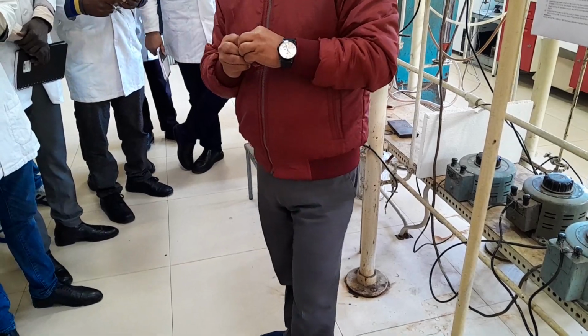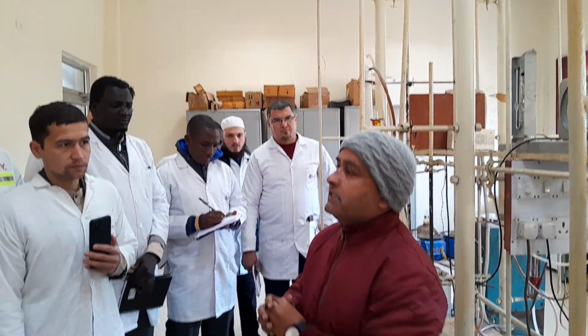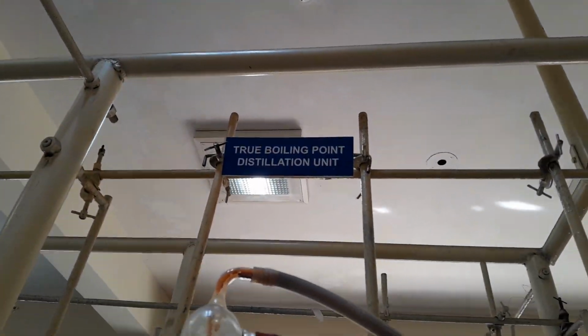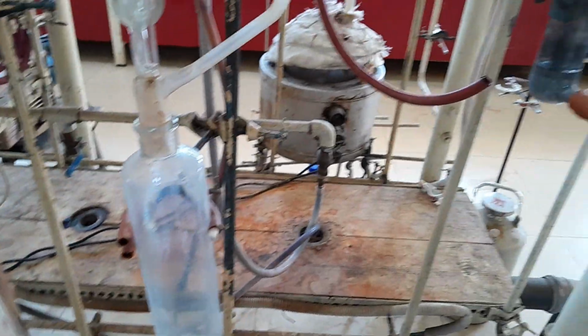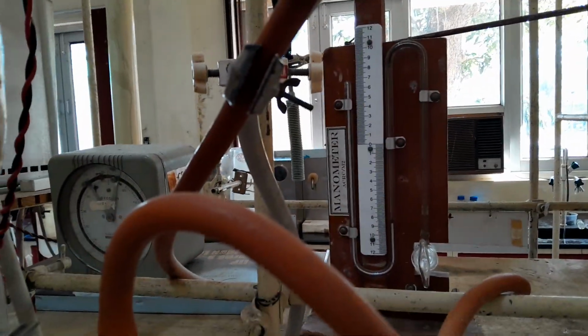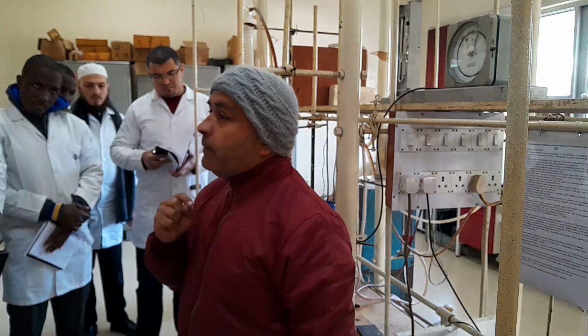Why? Because without knowing the water content of the crude oil, if you start the fractional distillation directly, it will create problems during the distillation process. Do you know, 1 ml of water, when you heat it up, that water vapor occupies an area of 1700 cc, more than that of 1 ml of oil vapor. So it will create a hurdle during the distillation process.